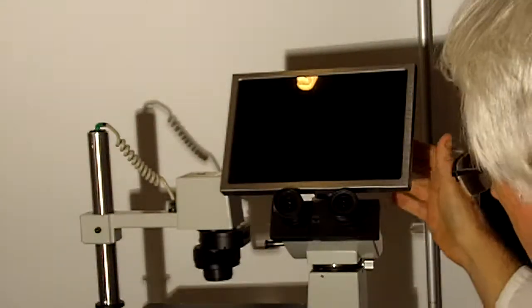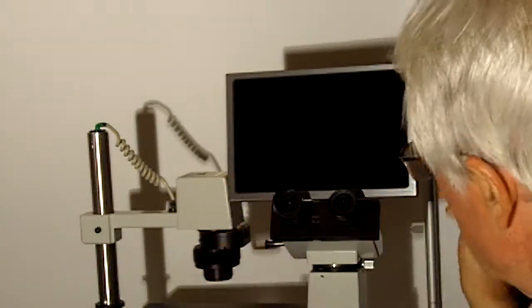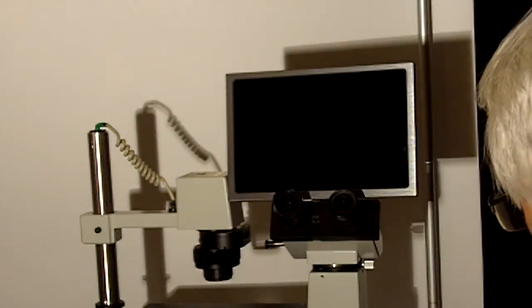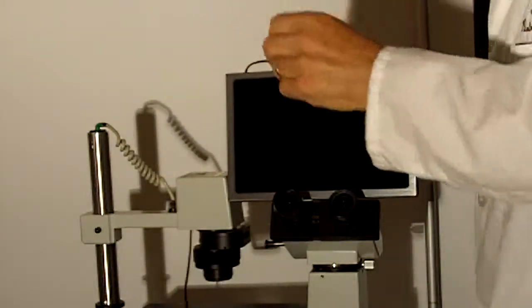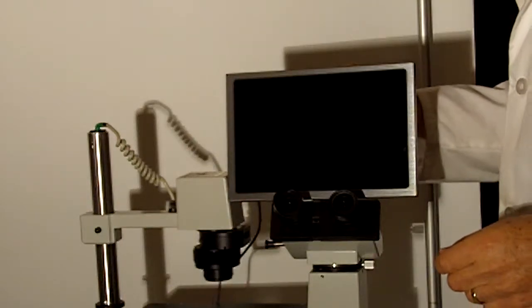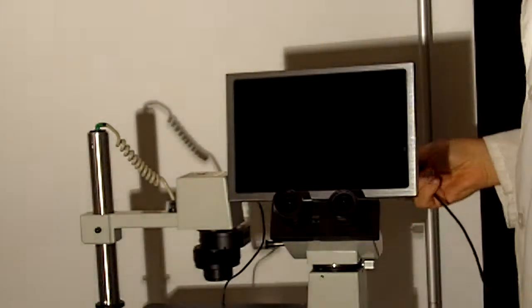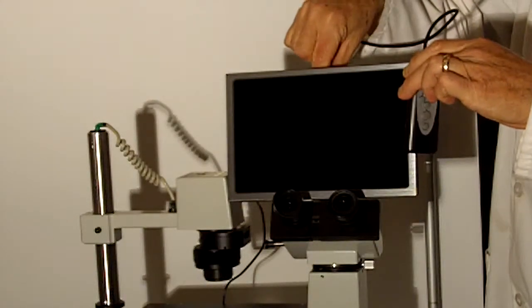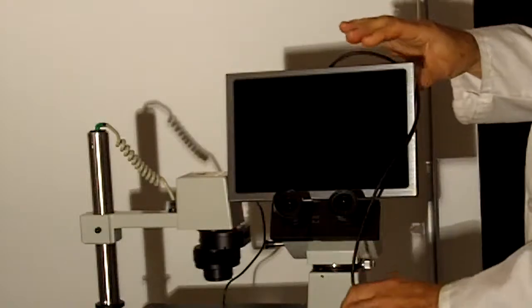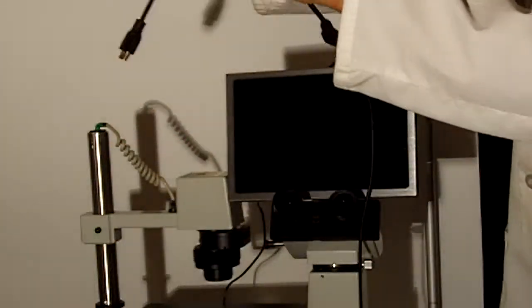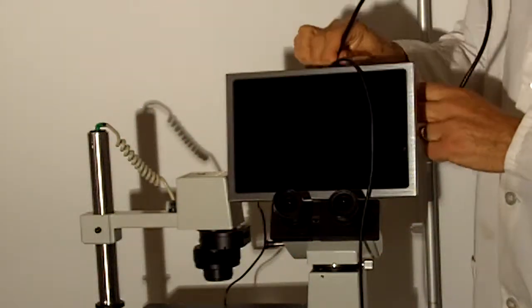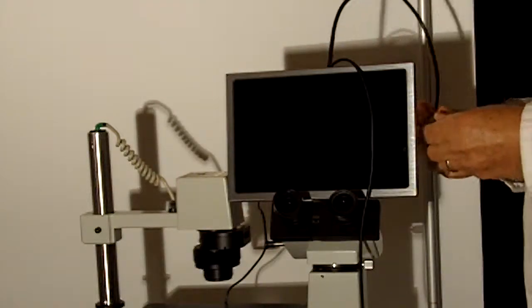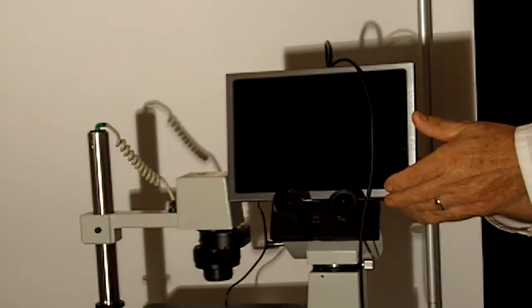Once we have the screen and camera mounted to the microscope, we can connect first the power, then the remote control, and then the included HDMI cable that carries the signal from the camera to the display.